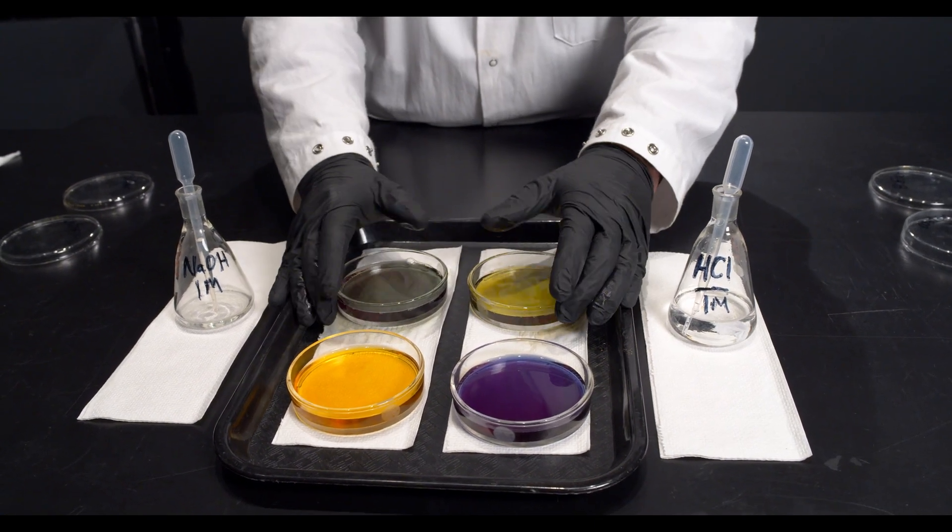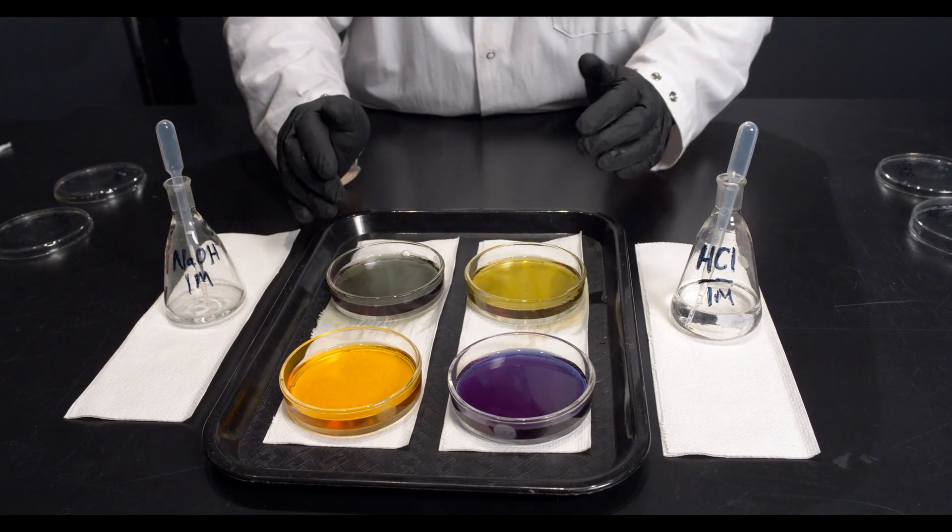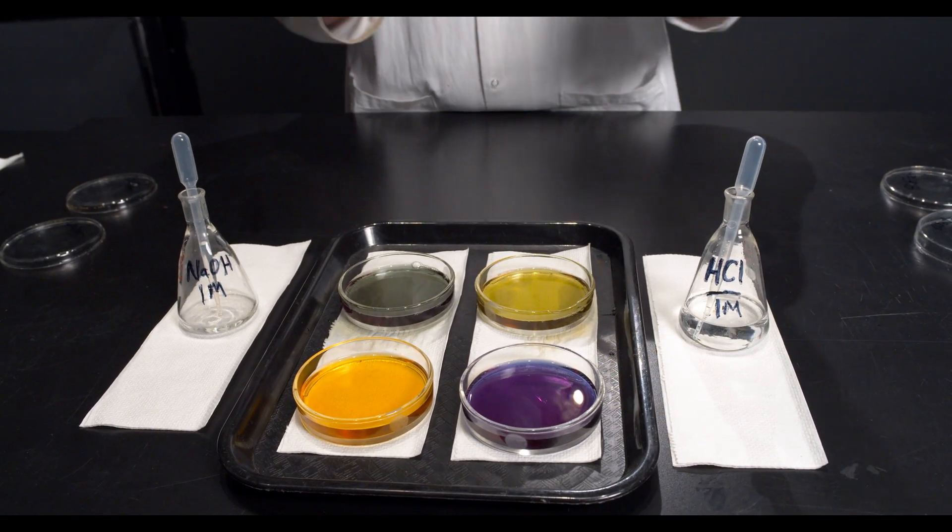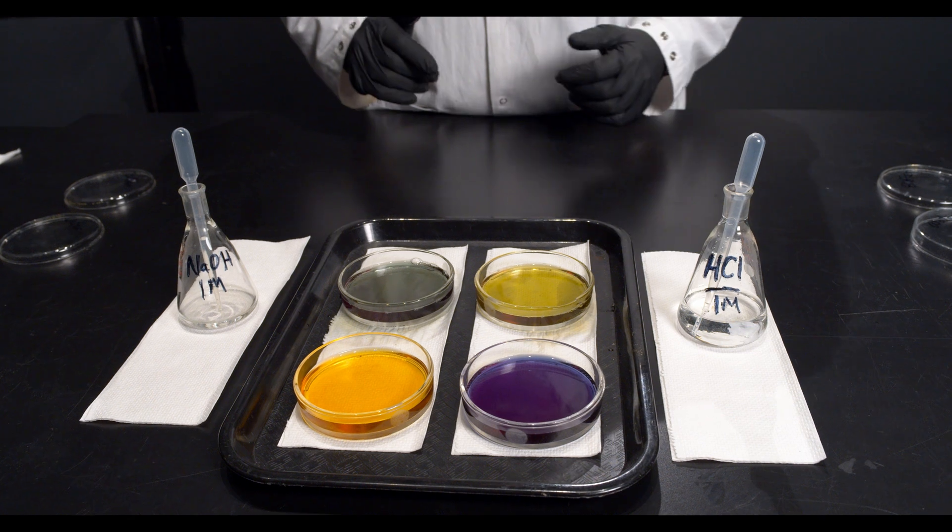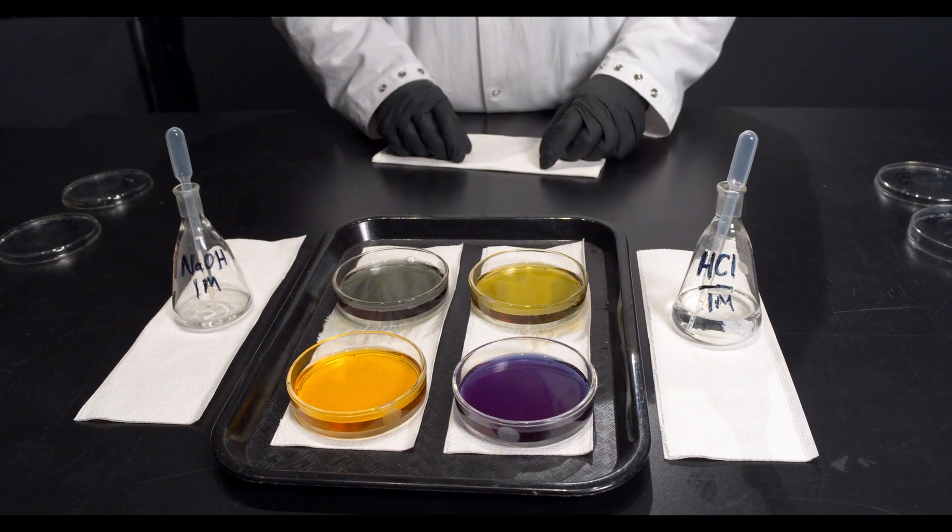So this is a demonstration of a buffer and how they resist changes in pH and of water, pure water, very sensitive to changing pH on addition of a strong acid or a strong base.